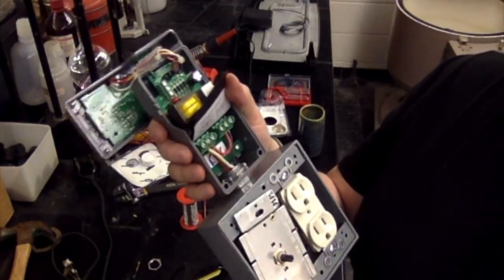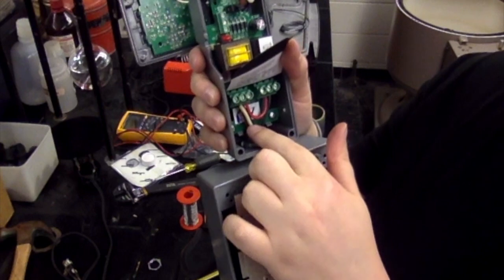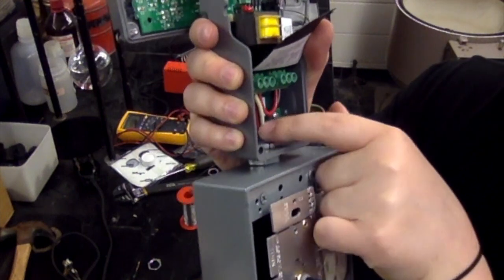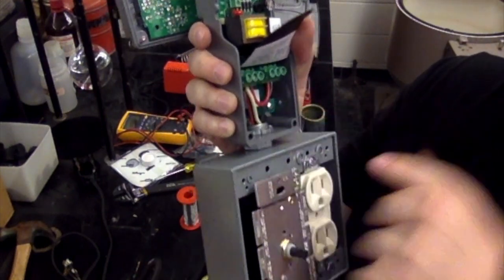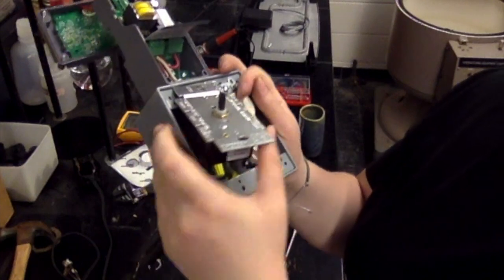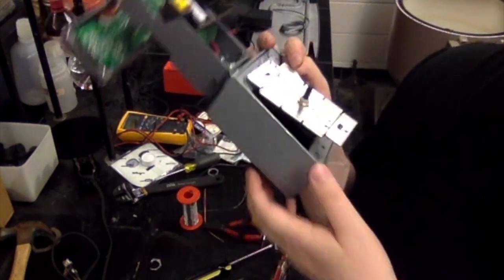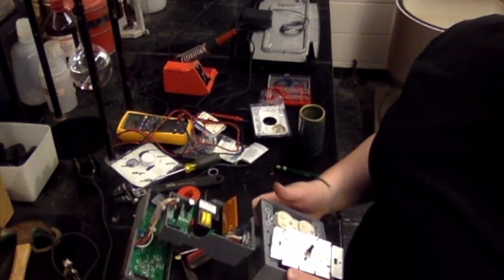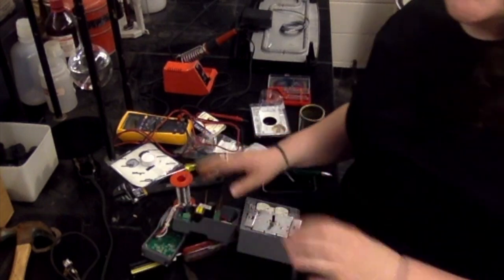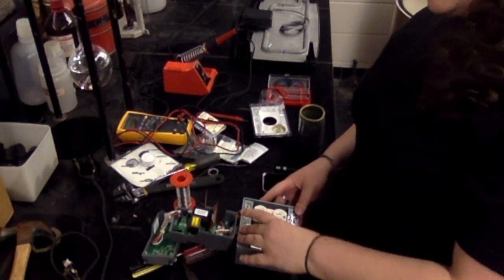Okay, so just to show you guys what those connections look like, we have the white cord from the line cord that's coming up into port number 2, as well as, it's kind of hard to see, but there's a red line back there too that's also in port 2 coming down and connecting to the silver part. Man, that's hard to see. The silver part on the two gang outlet. So once that's complete, that's really all of the connections that you need to make inside the outlet box. There's a couple more things that we need to connect up top, but I'll go over that later.